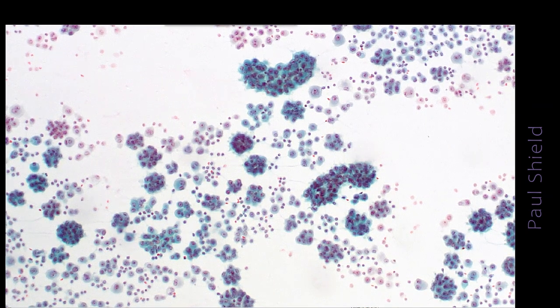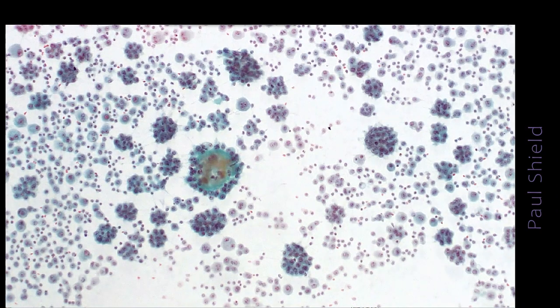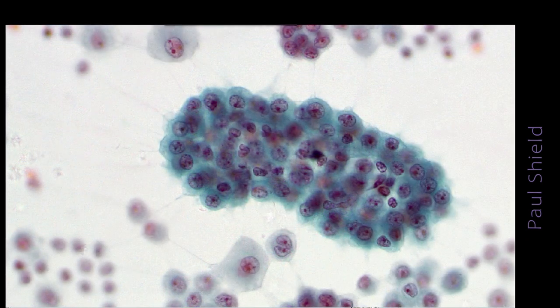In the pleura, then we know we're dealing with malignancy. It's simply a matter of what sort. This is a feature that you sometimes see as well, and they are collagen cores within the cells, staining that sort of greeny brown. Here's a typical group, and you can see the scalloped outline to the group formed by the centrally placed nuclei of the mesothelial cells.